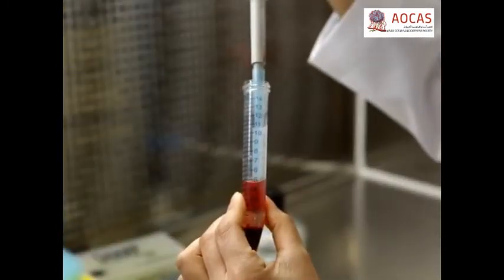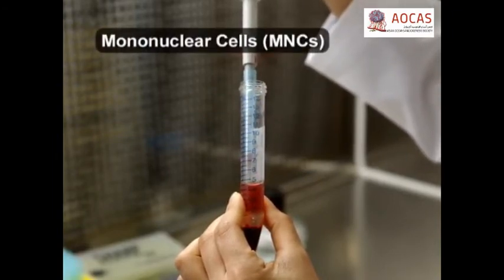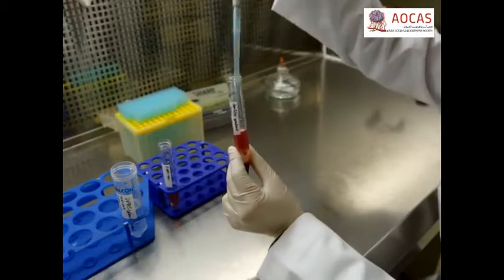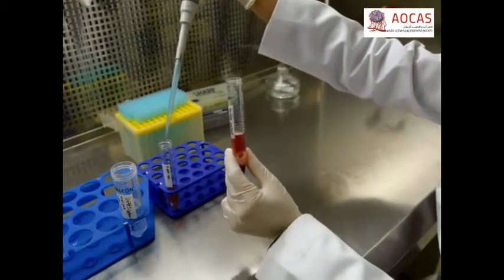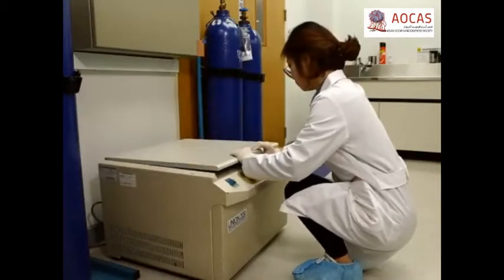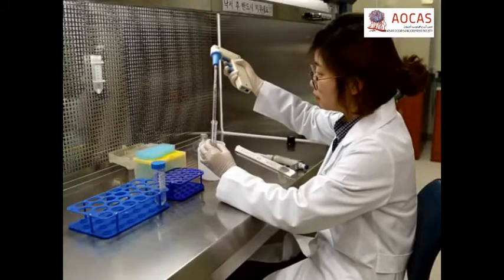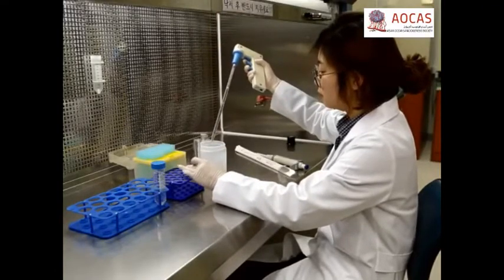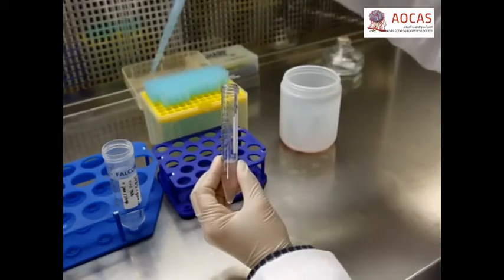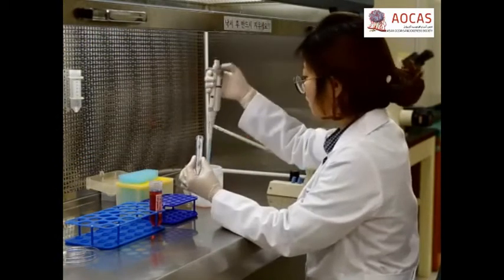The desired MNCs are collected in the central white layer — aspirate just this layer. Eject the MNC layer into a 15-milliliter conical tube and dilute it with 7-8 milliliters of DPBS. Then, centrifuge the cells at 500 G's for 10 minutes at room temperature. Discard the supernatant and wash the pelleted cells twice with 10 milliliters of DPBS, repeating the previous centrifugation cycle. After the two washes, re-suspend the MNCs in 2 milliliters of ADMEM.